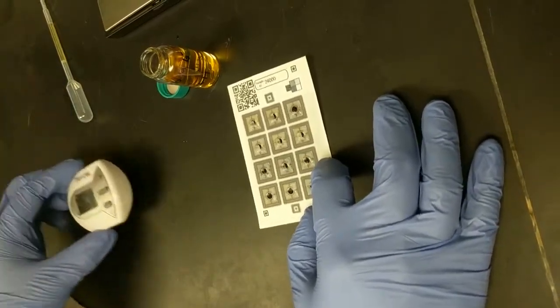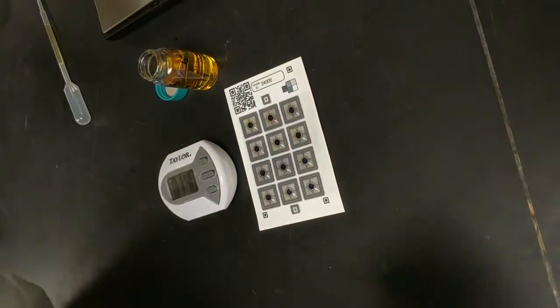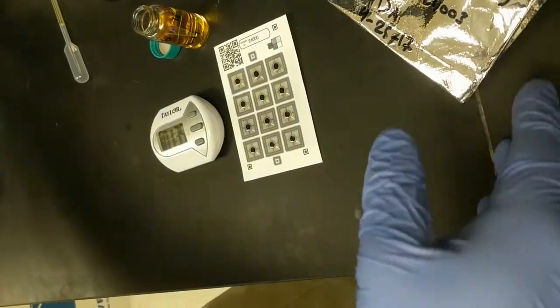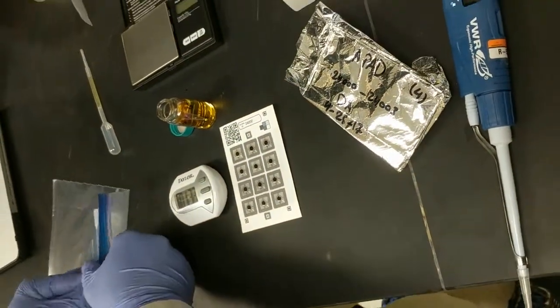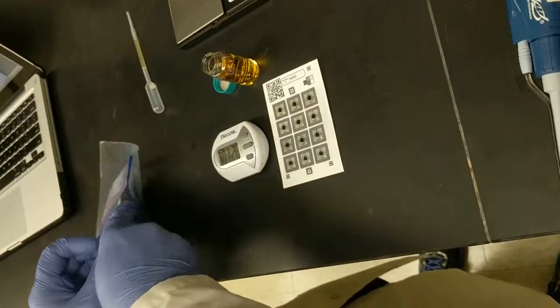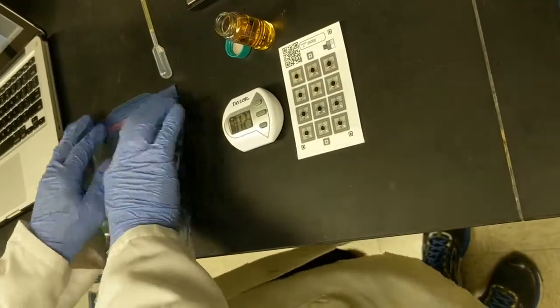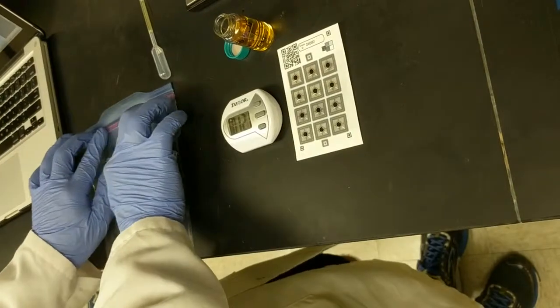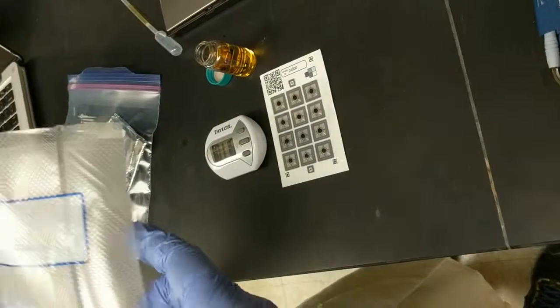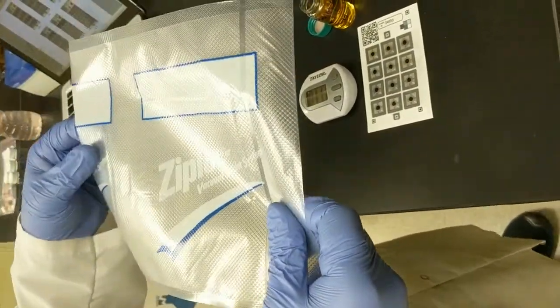While we wait for the 3 minutes to be up from the shaking of this test card, if you have remaining test cards that we sent you, you can store them in a Ziploc baggie. Just put them into the baggie, squeeze out the air, and seal it. The test cards should stay good for a few days this way. If you leave the test cards in the vacuum sealed package that we sent you, they should be stable for 3 months at 20 degrees Celsius.